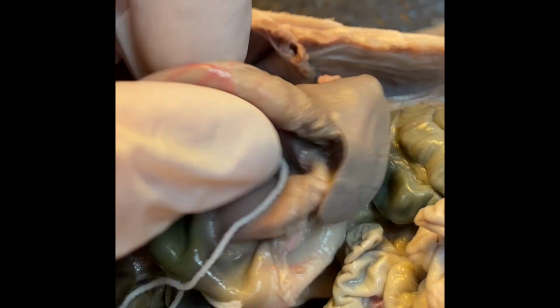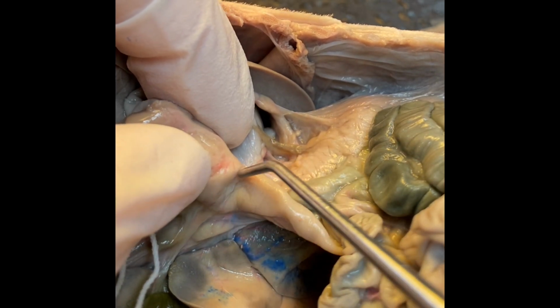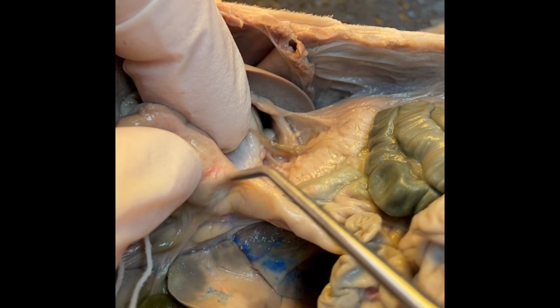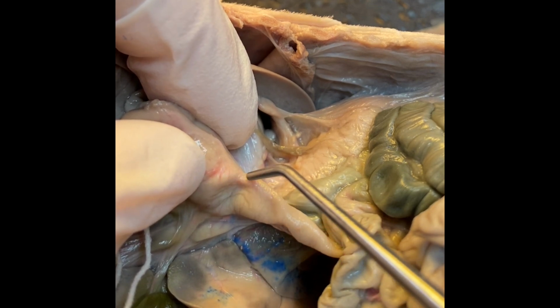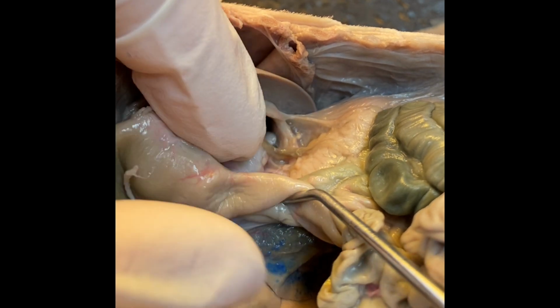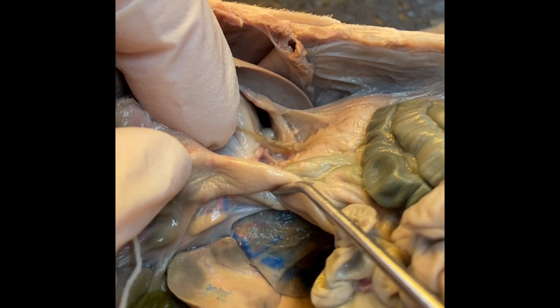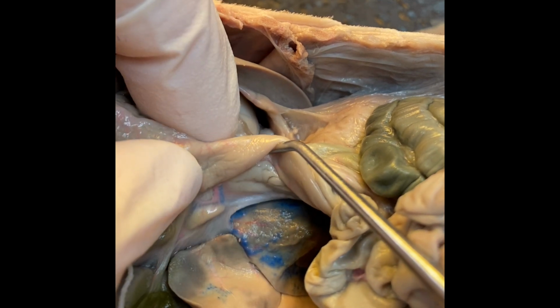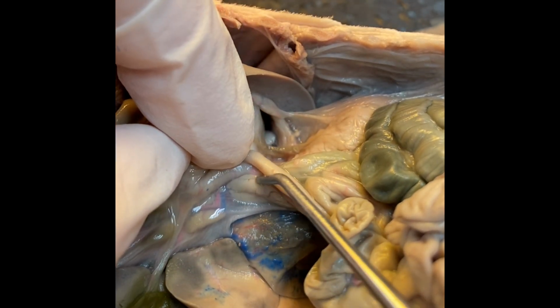From the stomach, the food will travel to the small intestine. This end of the stomach is referred to as the pyloric end, and this is where the pyloric sphincter would be. The pyloric sphincter is responsible for controlling how much of the chyme that is produced in the stomach makes it to the small intestine at any point in time. The initial portion of the small intestine is referred to as the duodenum, and this is where we will have digestive enzymes coming from the pancreas, which you can actually see part of the pancreas right here.